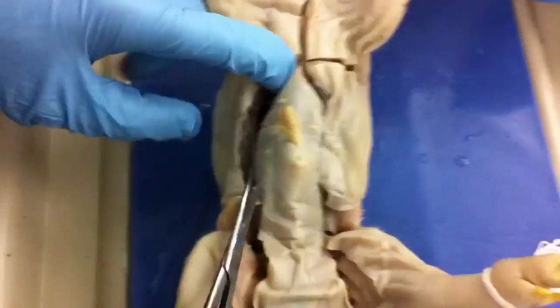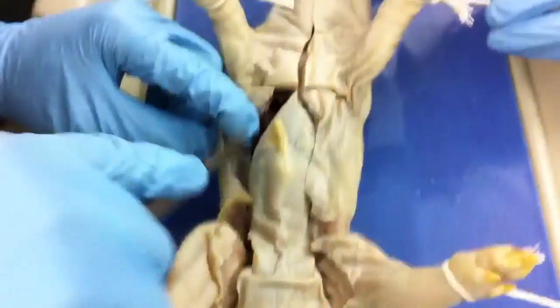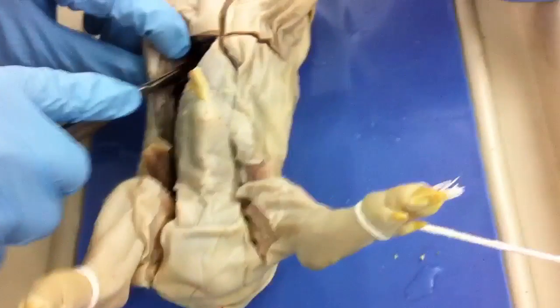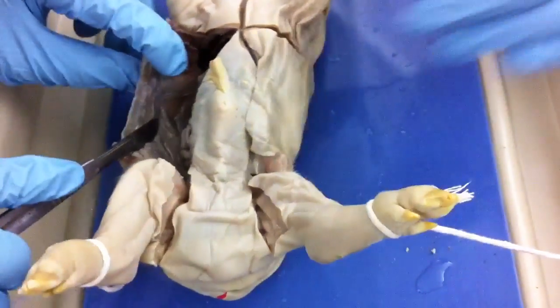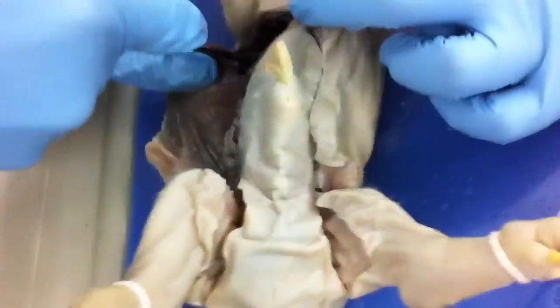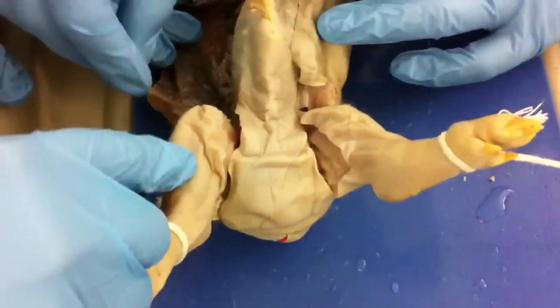It's not opening. Just force it. Alright, guys. Luke would have done it. I'm just going to cut it open. Just cut that. We'll begin the initial incision. There you go, good job Jesse. Pin that down. Really? I didn't notice. Just pin my finger, okay?